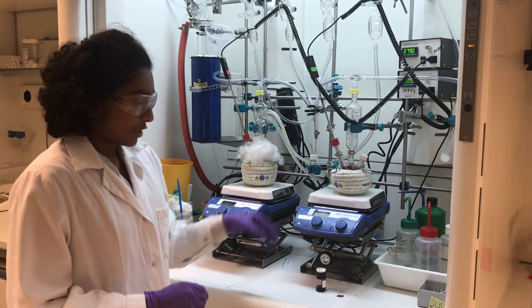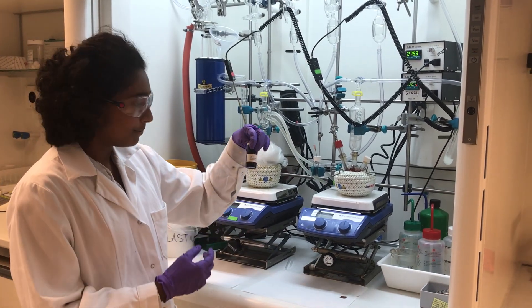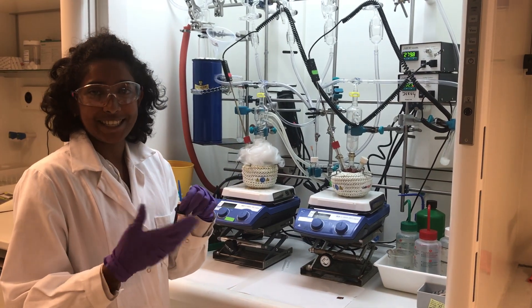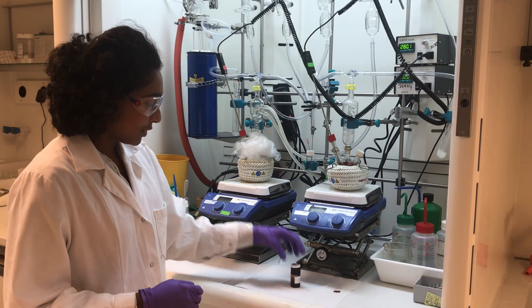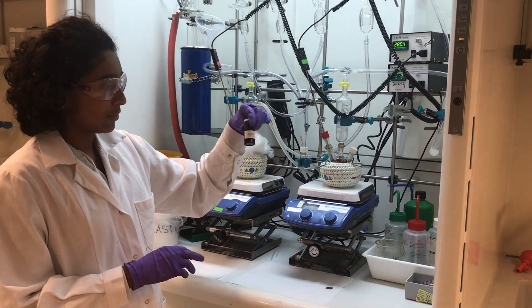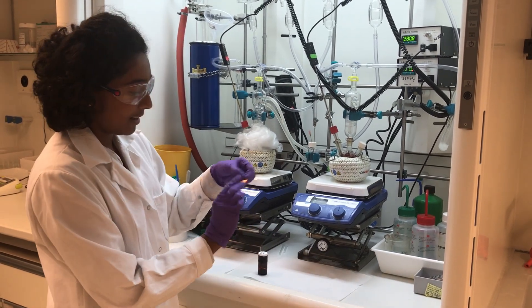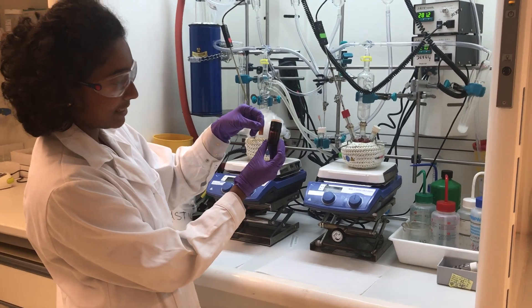At the end of the reaction we always have these crystals in organic solvents, which is very nice because we can process them very well. Here what I have is copper nanocrystals dispersed in hexane, and this is a copper foil in bulk, and this is the copper nanocrystals in solution.